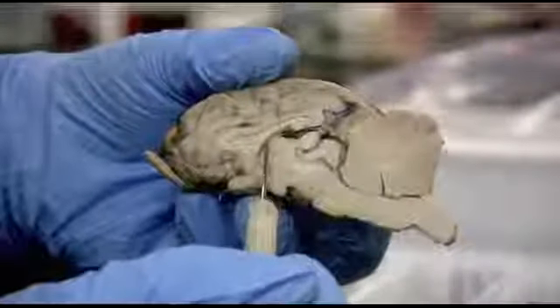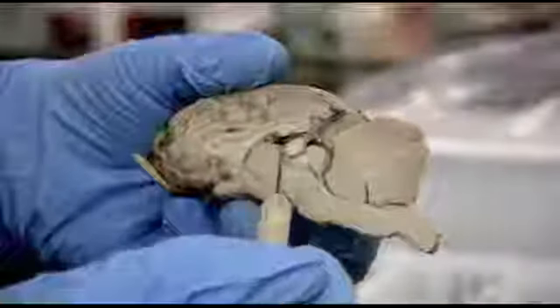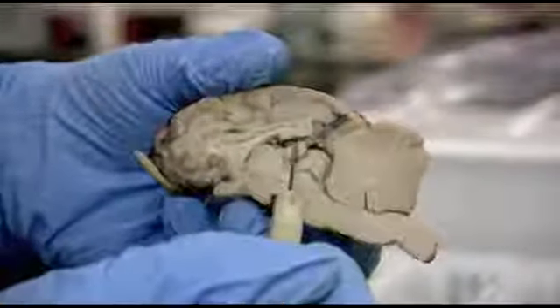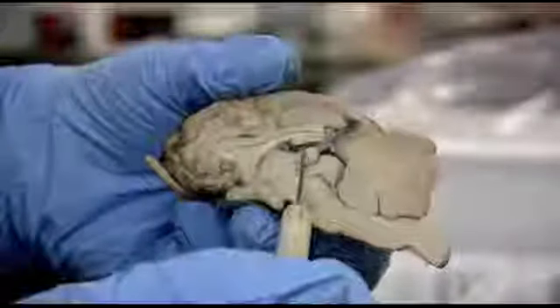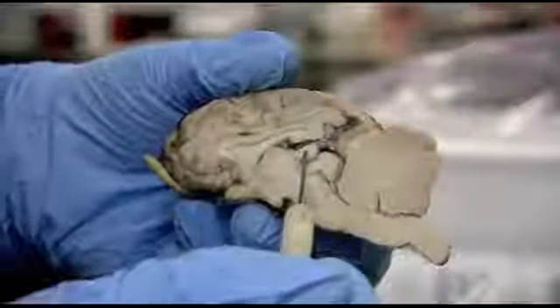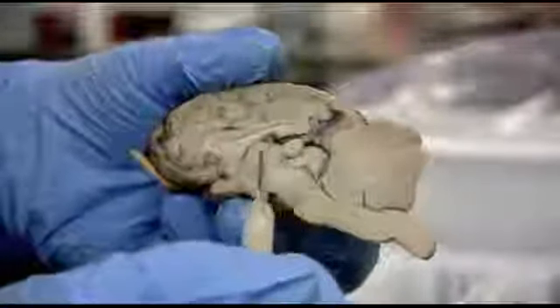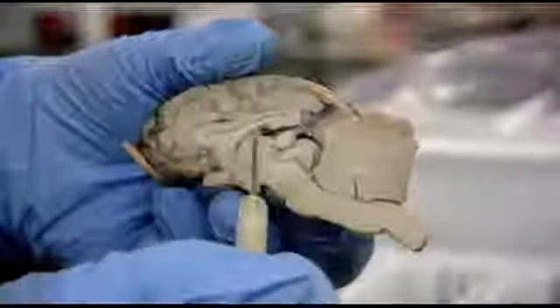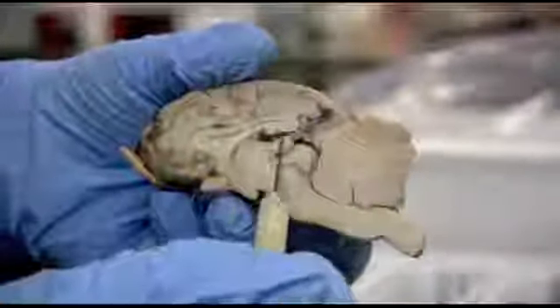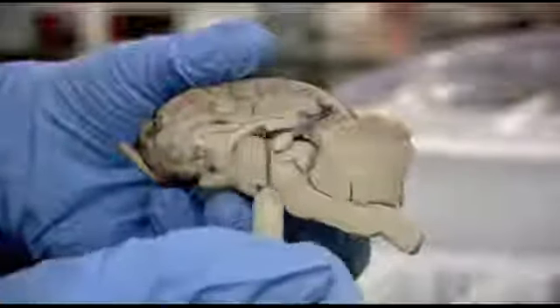Okay, the epithalamus is upon the thalamus, and it's going to go over the top of the thalamus, just a very thin line that's going to end here in this round structure, this other round structure. That's the pineal gland that produces melatonin that helps regulate your circadian rhythms. Okay, so it's pretty large. You can see here in the sheep brain, the big round circle is the thalamus. The smaller round circle behind it is the pineal gland. The epithalamus connects it.